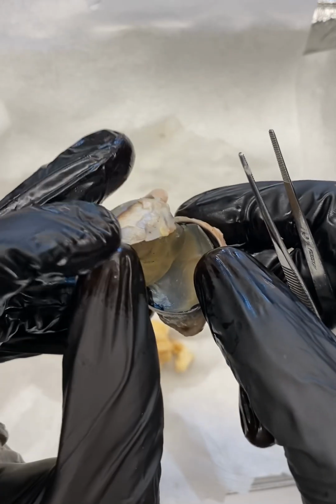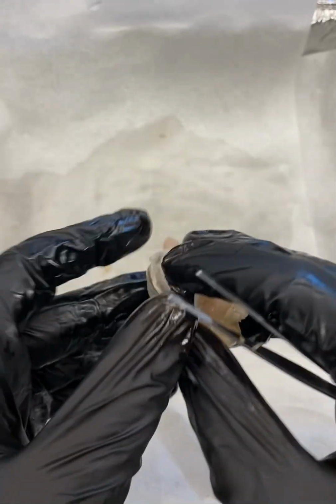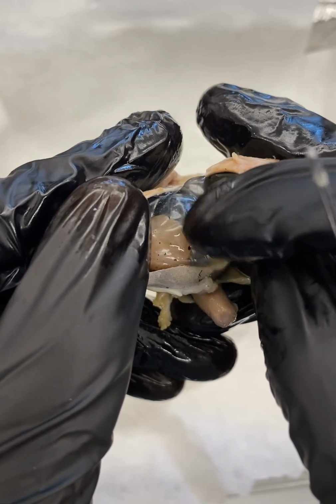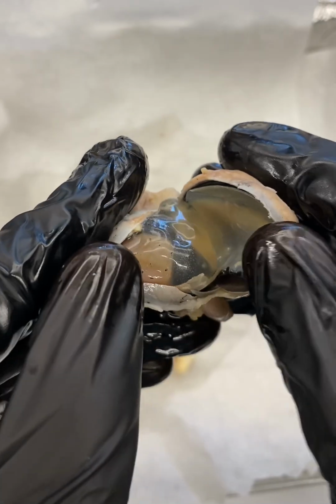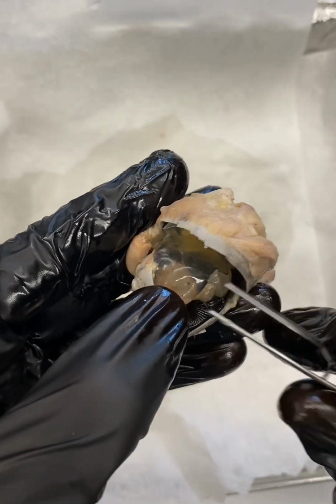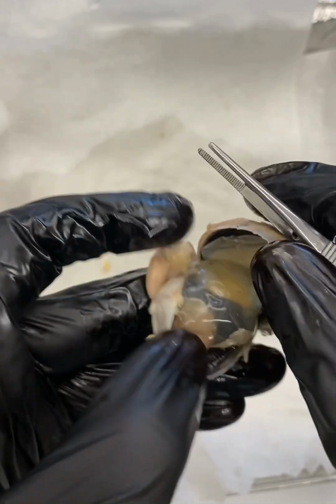First off, you may see a few things. One thing that you're surely noticing is this big gelatinous material here. This gelatinous material that you see here is something called the vitreous humor. Sometimes it's called the vitreous body. It's this thick gelatinous substance. Hopefully you can appreciate this. It's kind of the consistency of Jell-O in this preserved specimen.